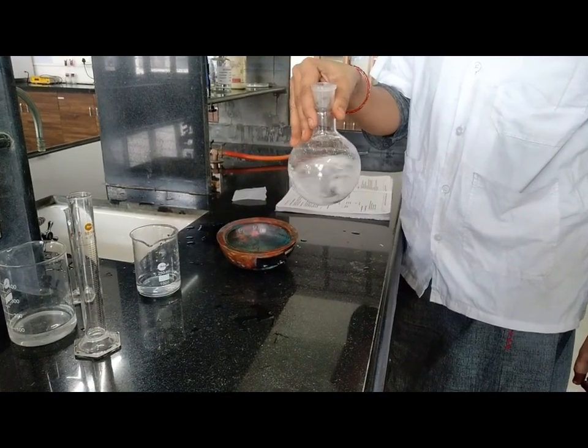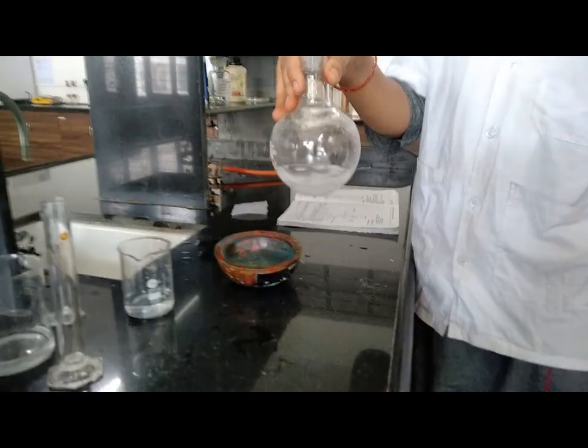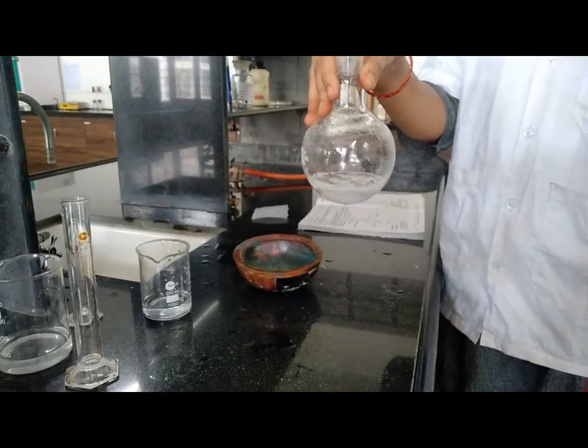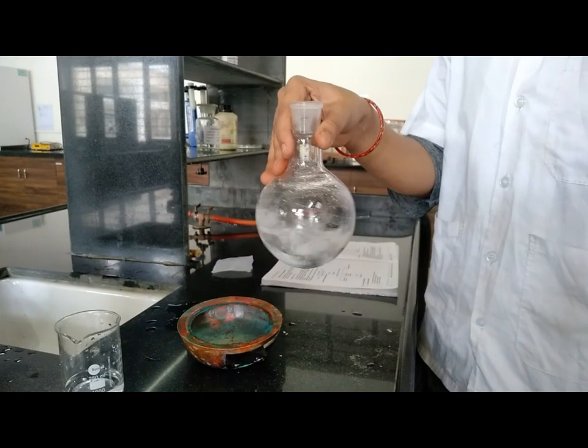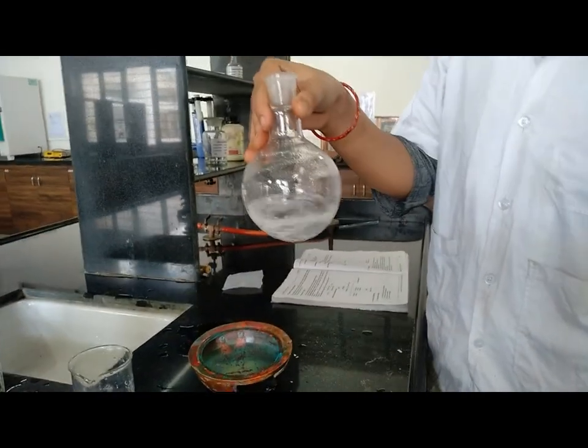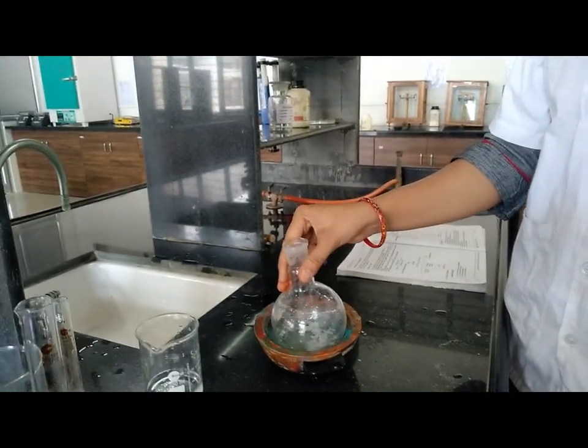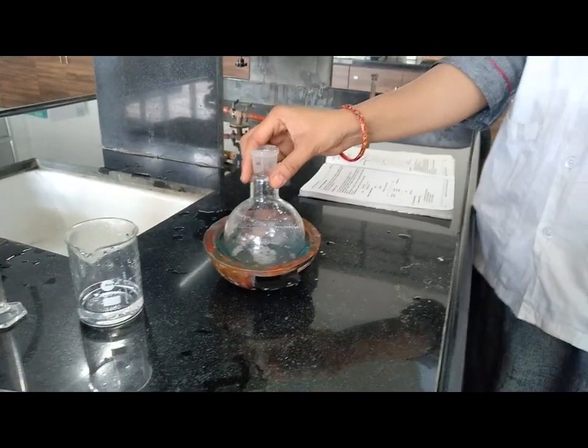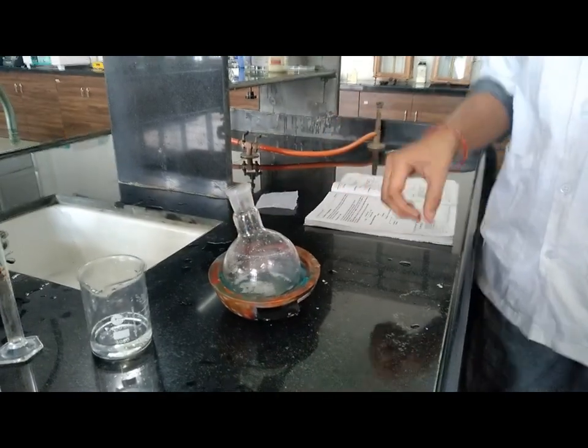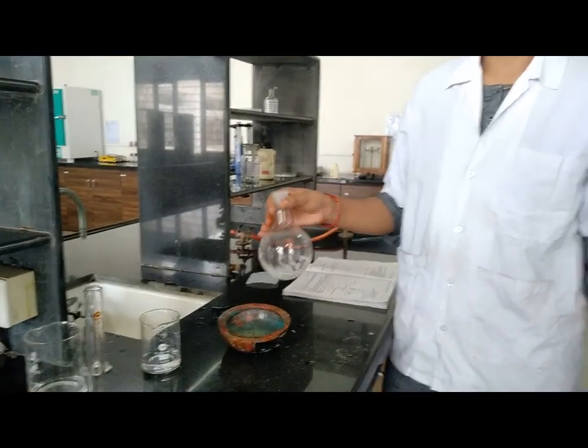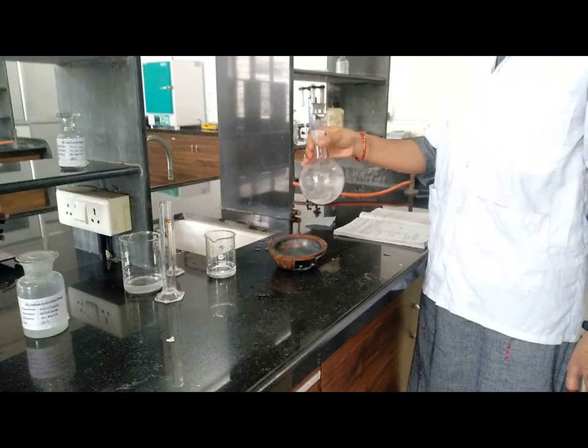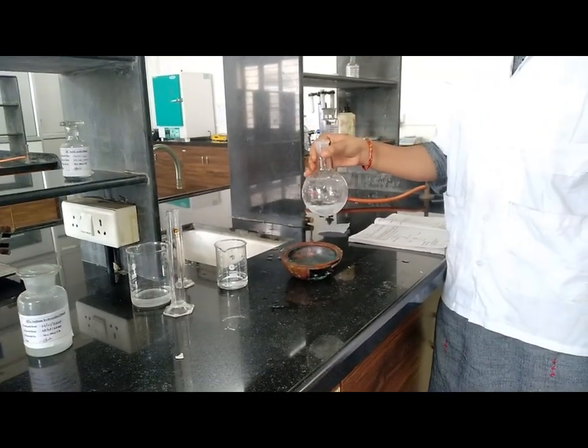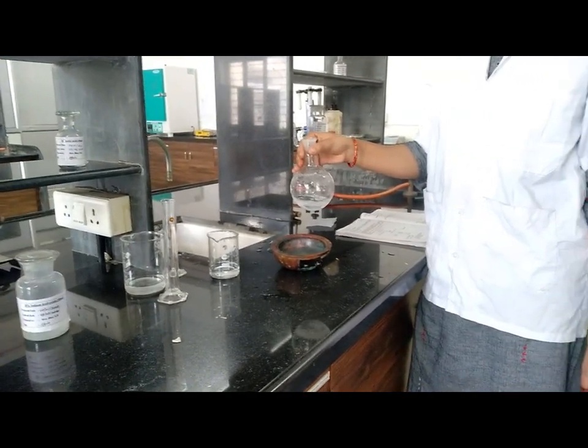After addition of concentrated hydrochloric acid, white precipitate slowly separates out. Now cool this mixture in ice cold water for 10 minutes. After 10 minutes, collect the product from the Buchner funnel at the filtration pump.